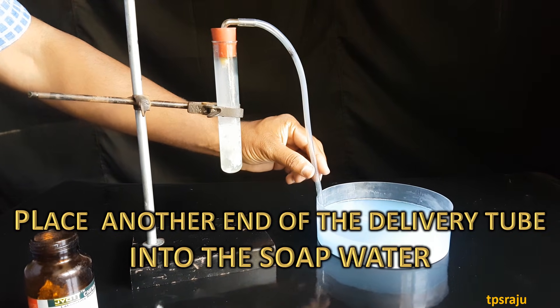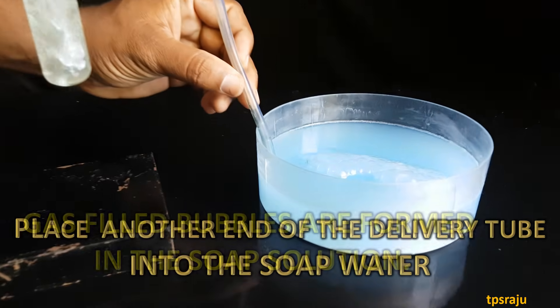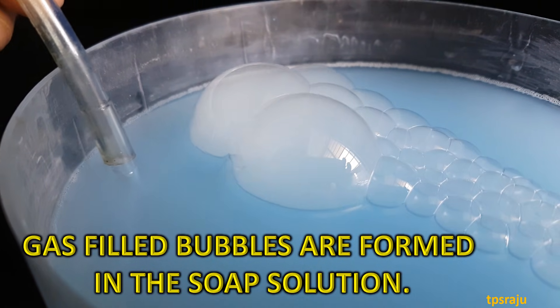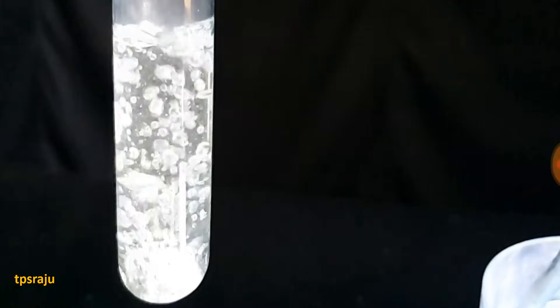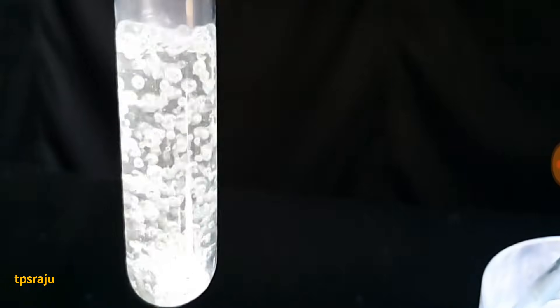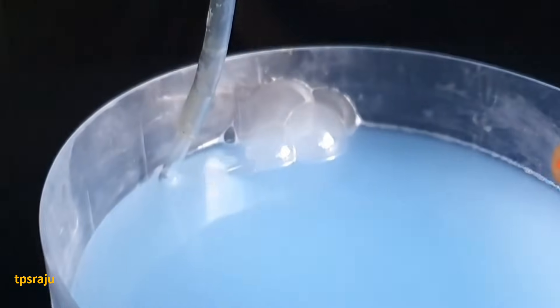Close the test tube with a one-hole rubber cork containing a delivery tube. Place the other end of the delivery tube into the soap water. Observe here — gas-filled bubbles are formed in the soap solution. Gas bubbles are also evolved from the surface of the zinc granules in the acid.